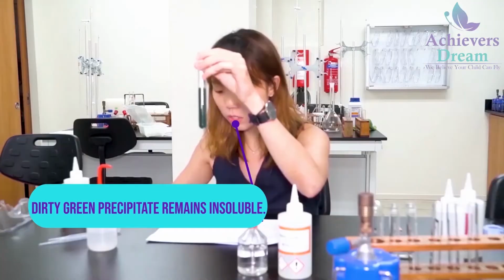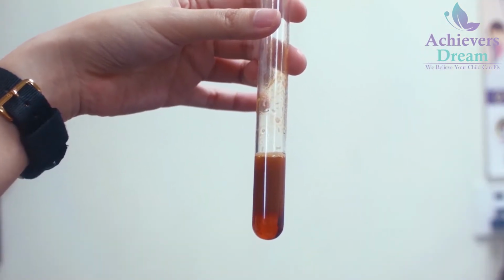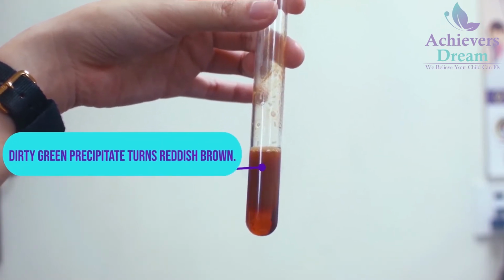Okay, so the next step is to allow the final mixture to stand for a few minutes. Okay, so this is the mixture after standing for a few minutes. So your dirty green precipitate has turned to reddish brown precipitate.